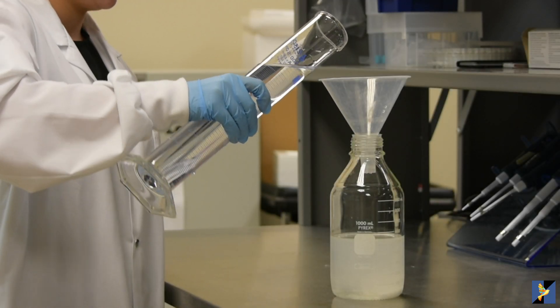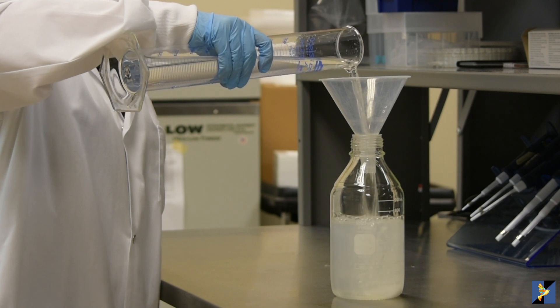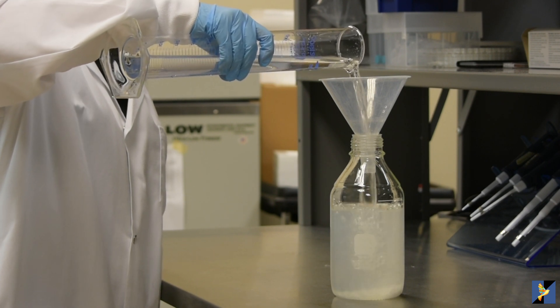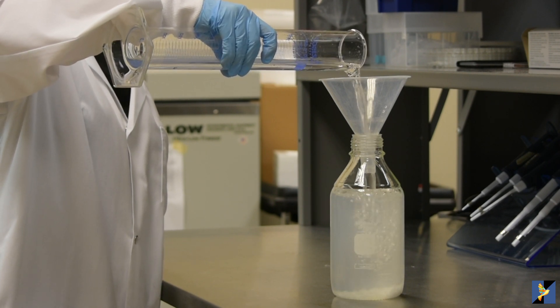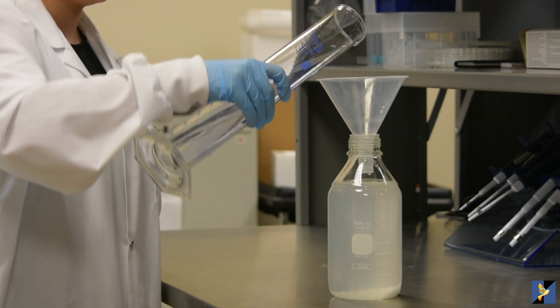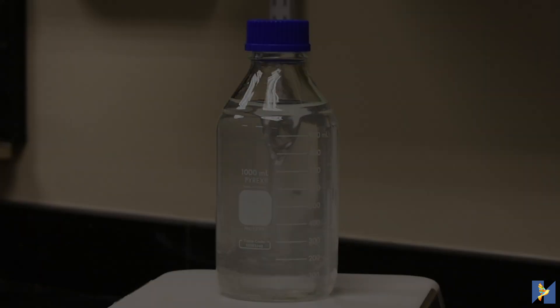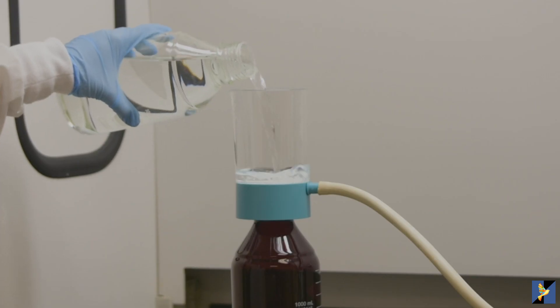Bring the final volume up to 1000 milliliters with ultra-pure water. Stir until completely dissolved. Filter into a low actinic media bottle.